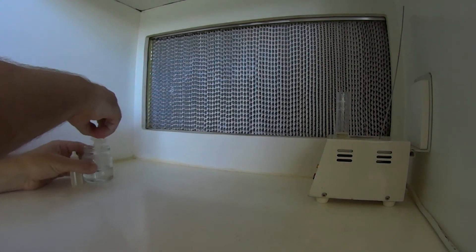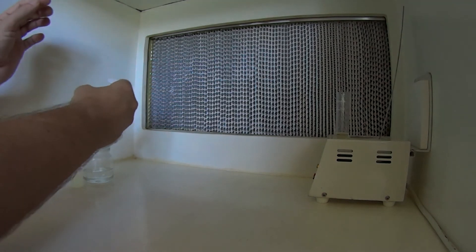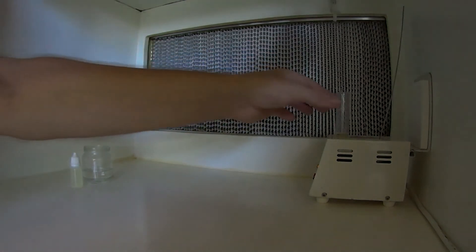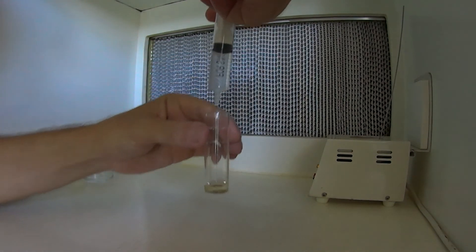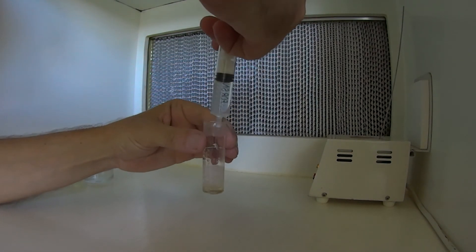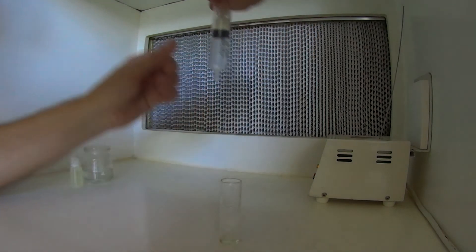Now I've already boiled this water, it's distilled water, so it's still nice and hot. We can see, I'll bring it over, just be careful because that happens. Let's put it down here, hopefully you can still see it.